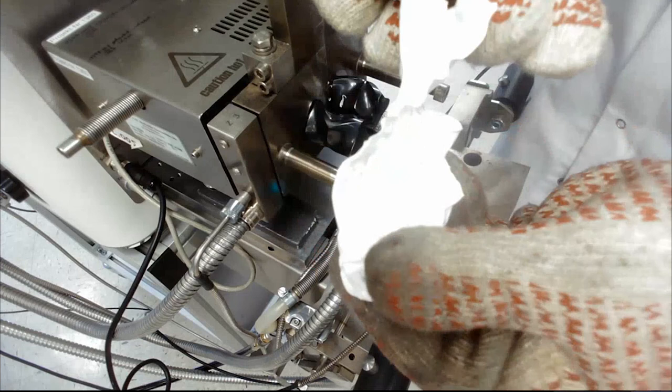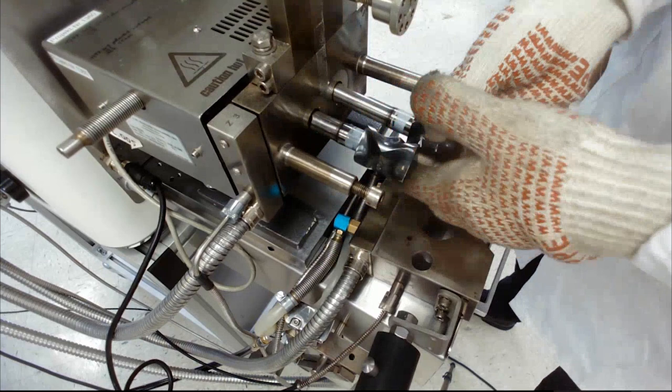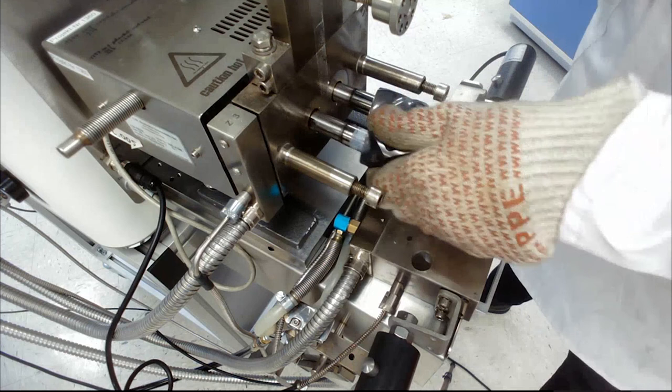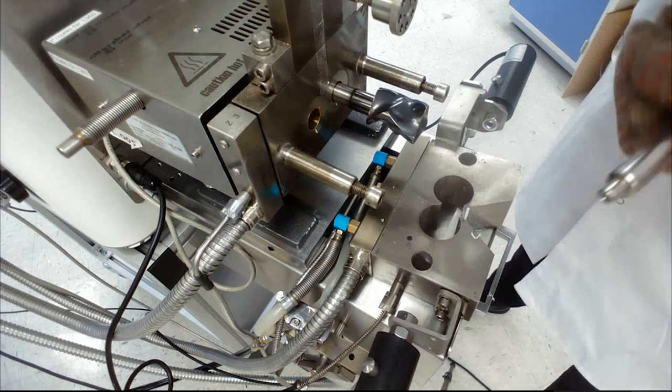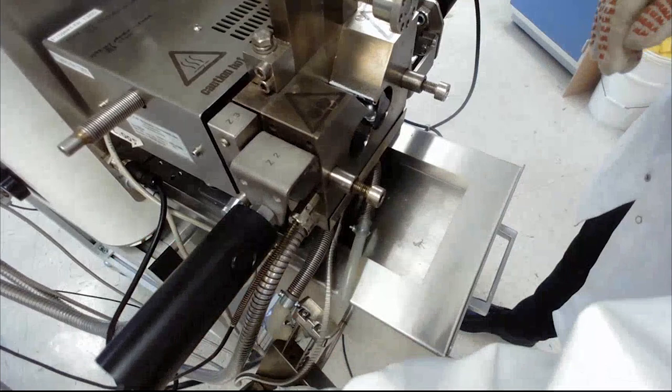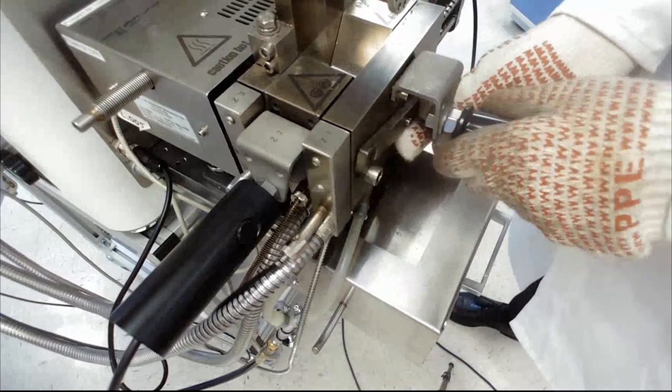The blades are different here too, it's very easy to clean them. You can just independently put them in after you clean the mixer. In a quick time succession I was able to set up the entire mixer for the next round of tests. We can put them in individually, put the bowl back on, put the front plate back on, and we would be ready to go for round number two. But we will shift now quickly to the software.